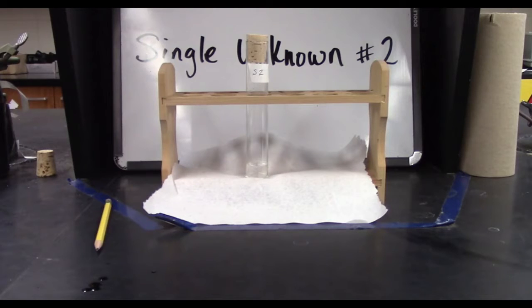Before any chemical tests are performed on the unknown compound, initial observations are made. As you can see, the compound is a clear, colorless liquid. It has an off-putting scent of roadkill and ammonia. It looks like there are a couple milliliters in the test tube. The boiling range of the unknown was taken, and it was between 104.7 to 107.2 degrees Celsius. Upon heating, there was no apparent color change or degradation of the compound.